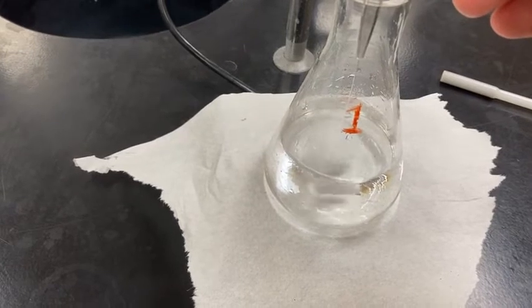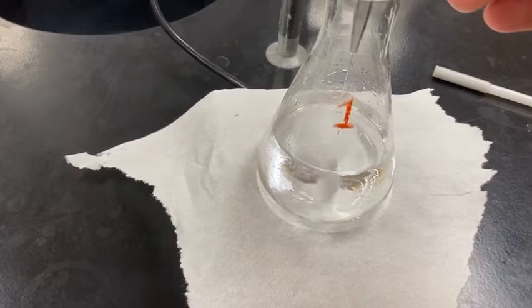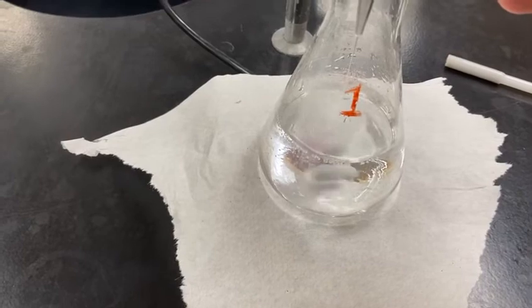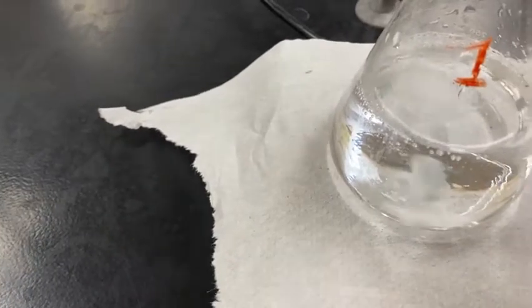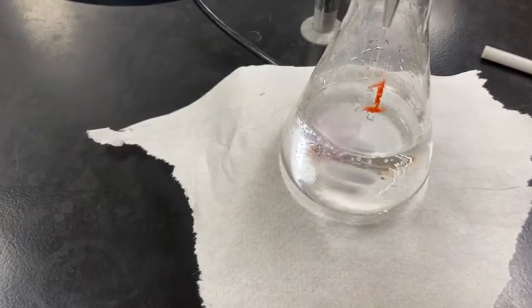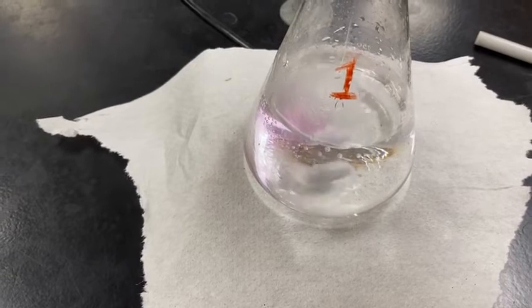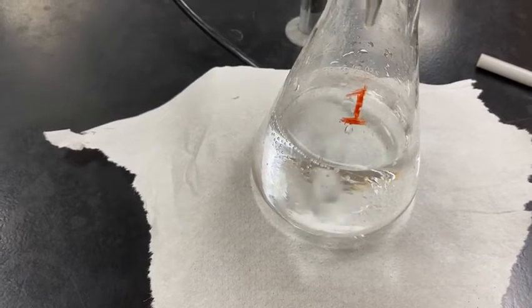And when that pink color makes itself persist, we know that the moles of acid are equal to the moles of base I've just added from the solution stoichiometrically, okay, from the reaction. Notice some of the pink that's coming up right now. If I stop that and let it mix, notice the pink fades away. So we're not there yet. That just happens to be some of the indicator hitting the base as it's falling in. Okay. Ooh, getting pink. Should I stop? I'll stop for a second. Okay, keep adding.